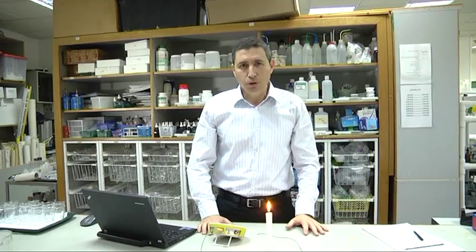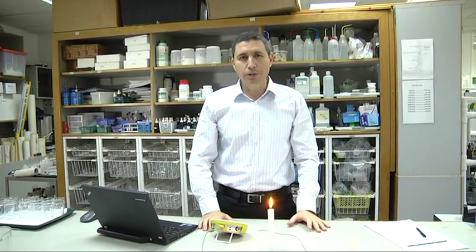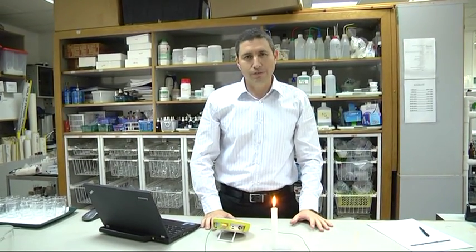Today, we are going to use the lab disk, the thermocouple temperature sensor, and the candle to explore combustion — a chemical process in which a substance reacts with oxygen to produce heat.